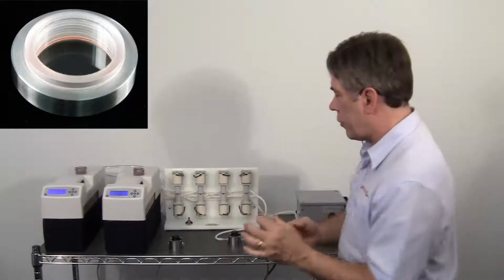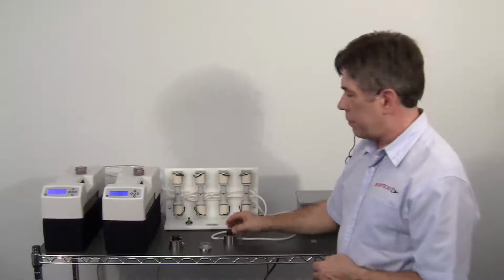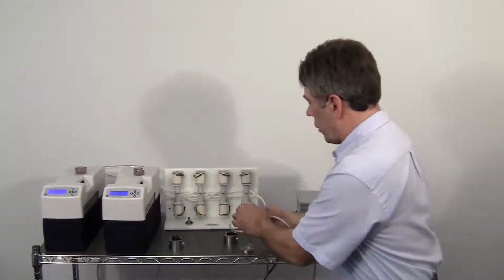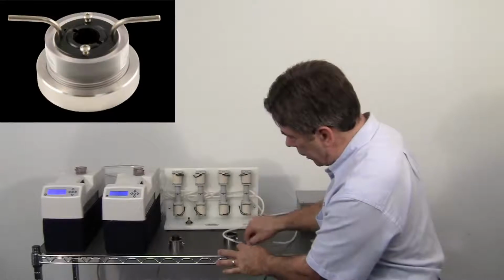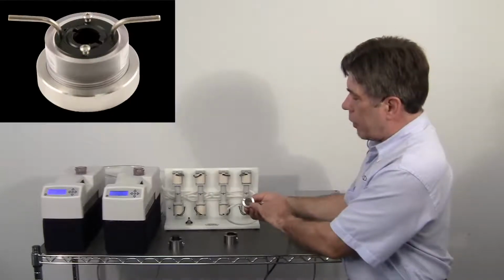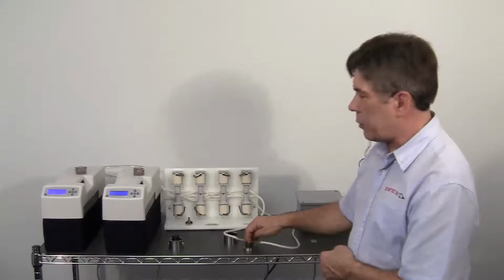Now this is the device that we will be placing the worm embryo holder into. Once the embryo is placed on top of the agar pad, this device is simply turned upside down with the embryo on it and placed inside the ICD. Now you have the embryo with the agar pad behind it directly pressed up against the cover slip and ready to sit into the microscope stage.